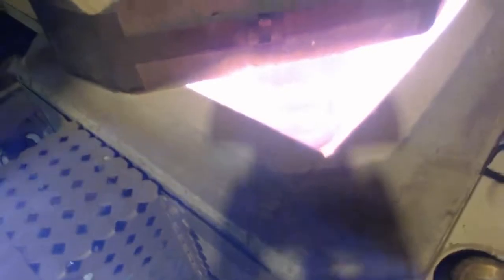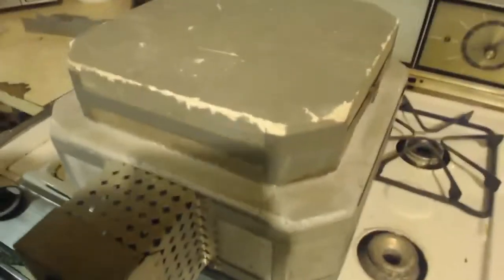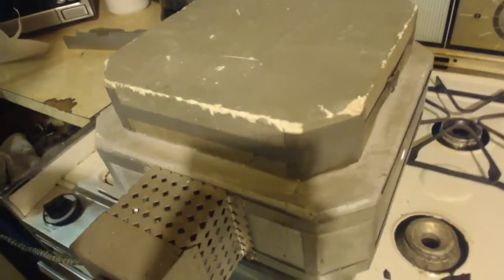Well, this is after 20 minutes. You can't even see in there barely. Oh my God, it's so hot. I've had it in here about an hour. Whoa! I don't know if you can see in there, everything is glowing red. Okay, I'm going to have to close that up.